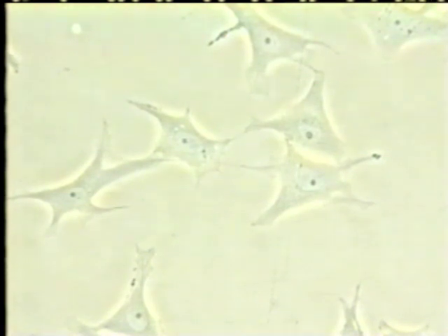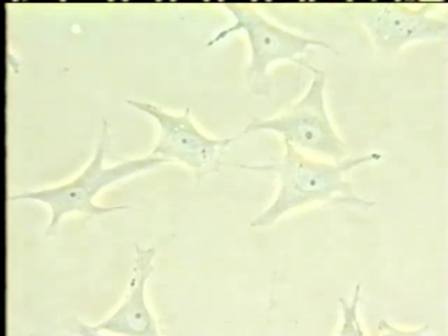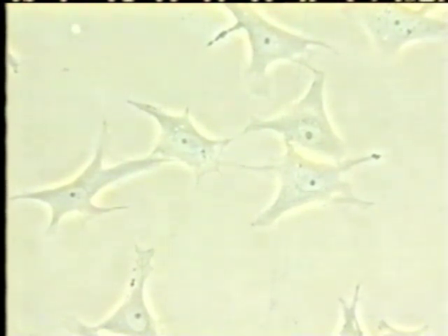In the presence of the same 1 milligram per milliliter concentration of PB100, normal astrocytes undergo no morphological change. A yellow cloud of anti-cancer agent simply underlines external cell contours and it does not enter the cell. Under ultraviolet radiation, astrocyte contents are in no way fluorescent.